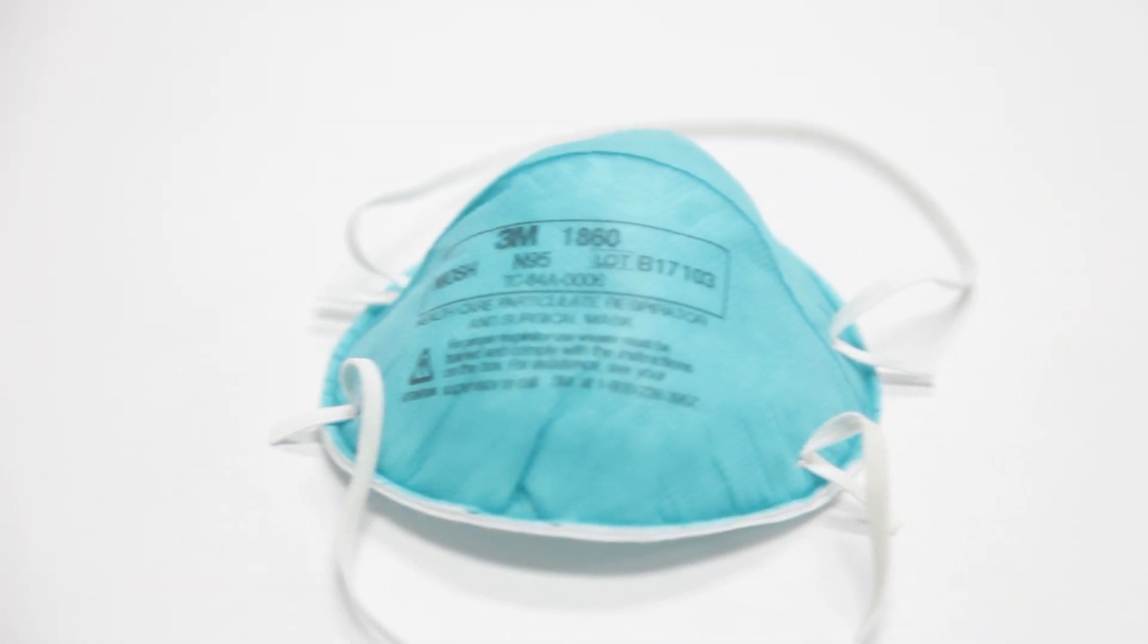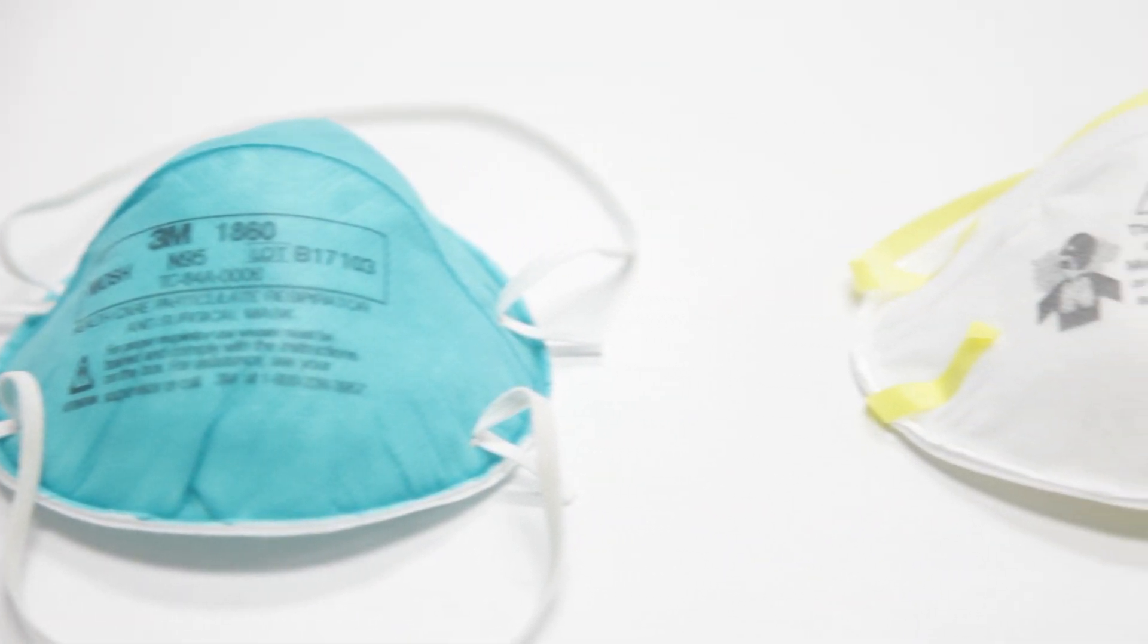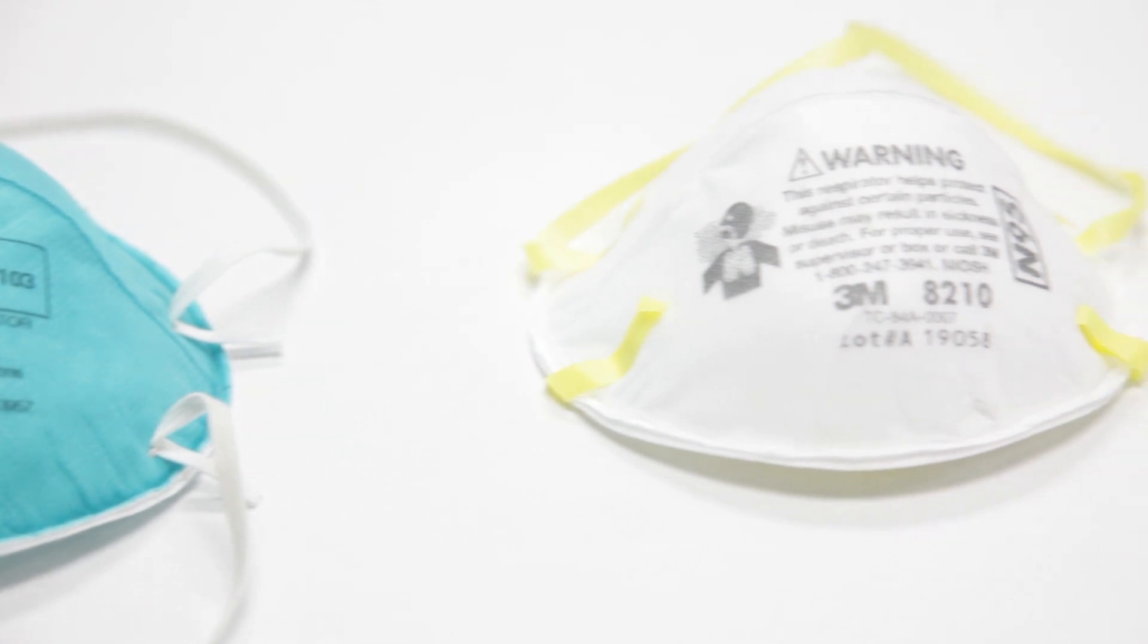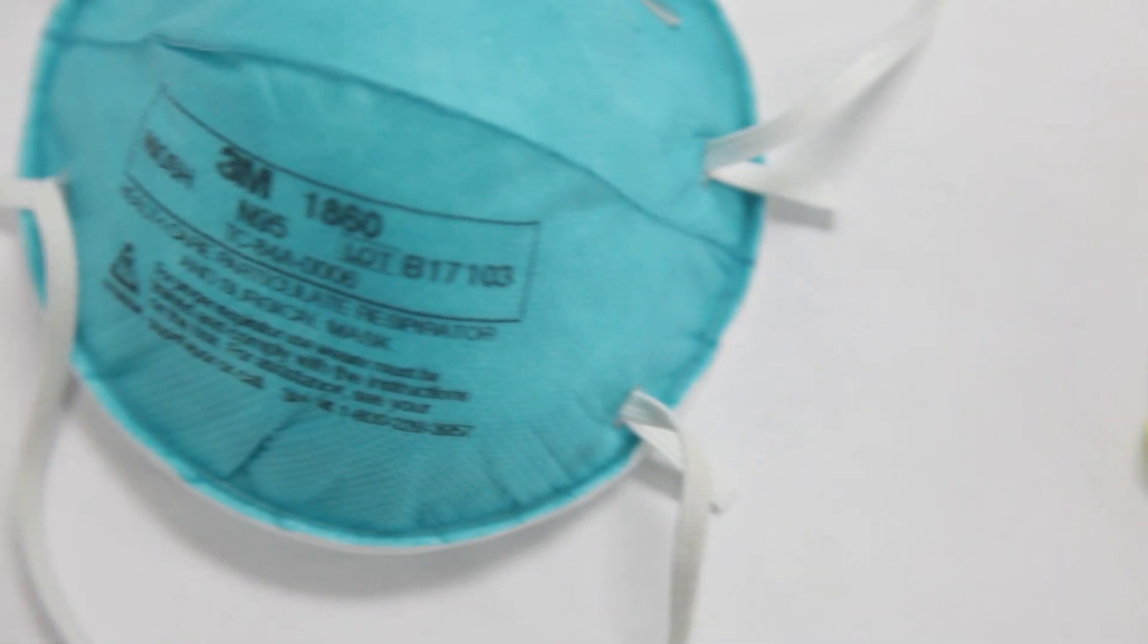There are different makes and models of N95 masks that all look and fit slightly differently. However, following procedures to correctly don and doff your mask will be generally applicable across the board.